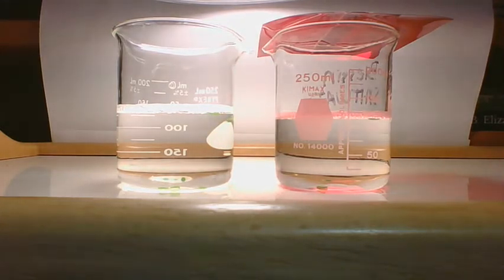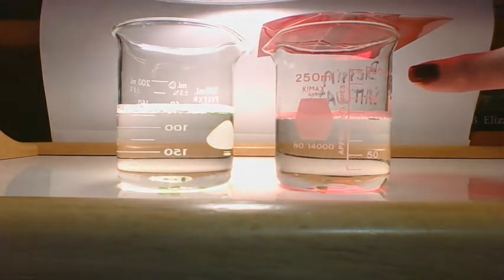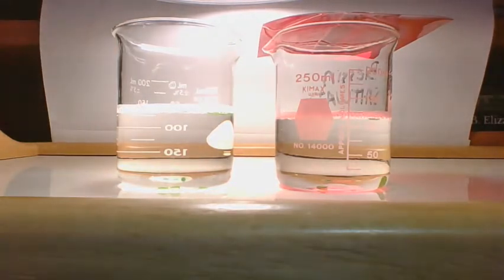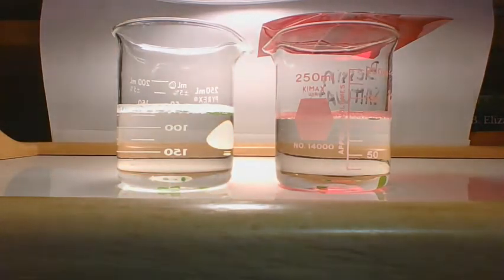Okay, at 5 minutes, we have two in the clear water and one with the red filter. So the red filter has one and the clear water has two right now. I didn't see it slide up there.